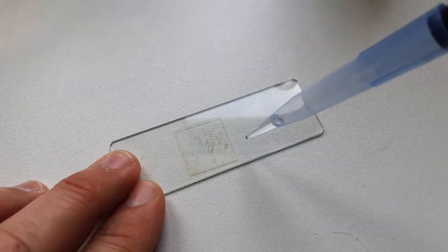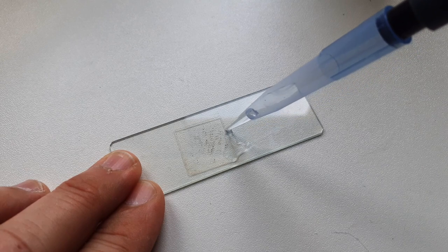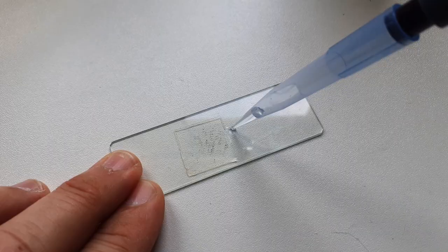So hi, Microbe Hunter here, and you probably already know of the problem that when you make a temporary mount, so basically a wet mount, where you put some water on the microscope slide, that over time the water is going to evaporate. So you observe the slide under your microscope, and you have to keep on adding a little bit of water all the time, especially if you put the slide under the microscope for a longer time. You always have to keep on adding water, otherwise the specimen is going to dry up and then everything's going to be dead on the slide.